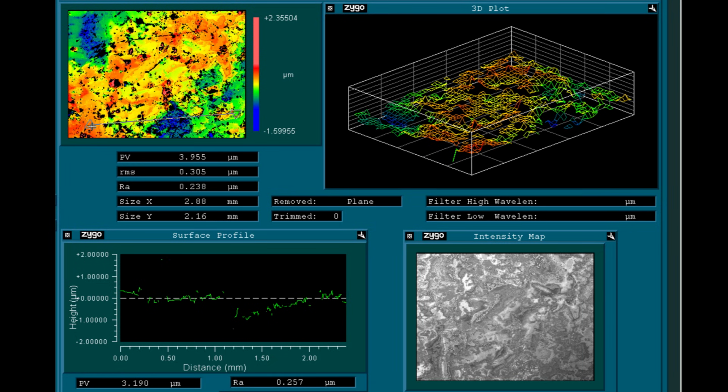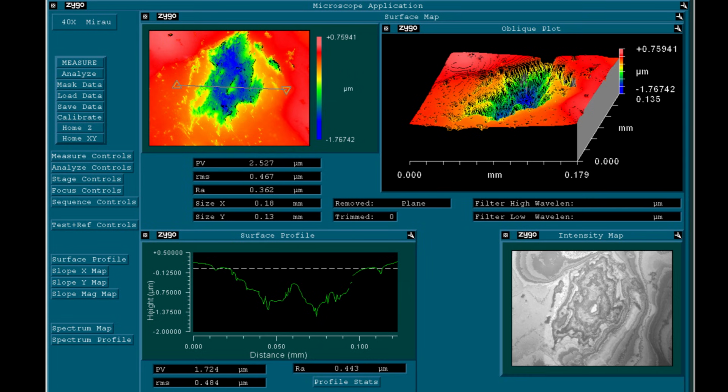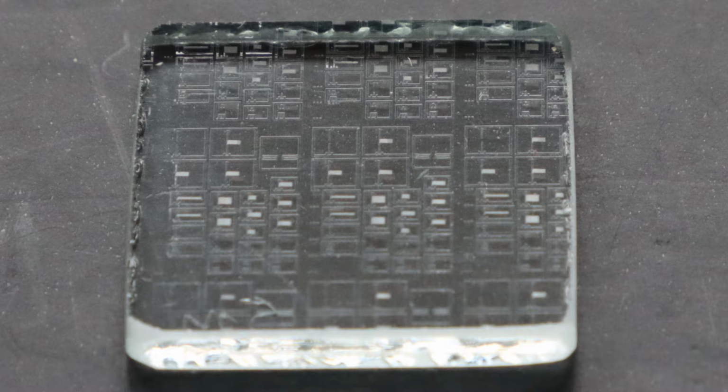The contour maps show that the surface contains quite a lot of deeper pits, and at a higher magnification of 40 times we can take a more detailed look at the slopes of such a pit. It looks like a huge canyon in this image, however it's only around 2 microns deep and 70 microns wide. I think that these pits arise from the empty volumes or pockets present in the granite material that open up during grinding and polishing.